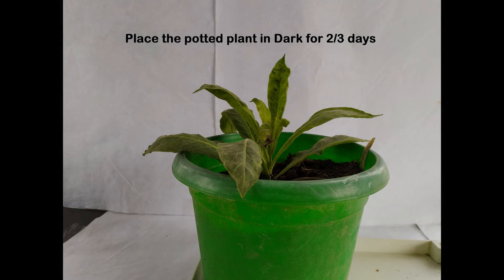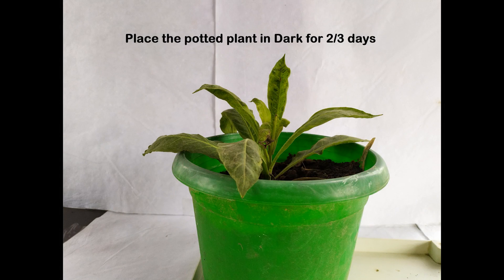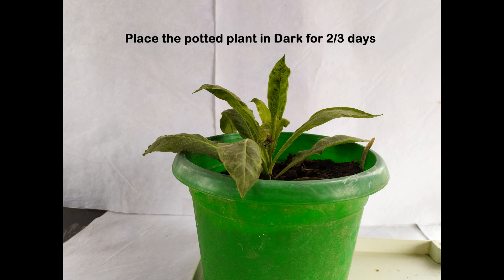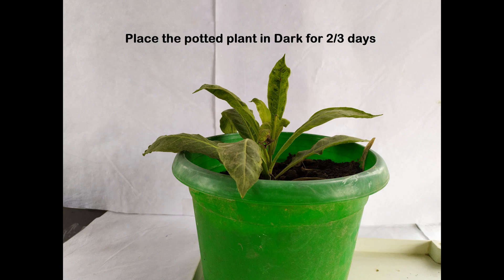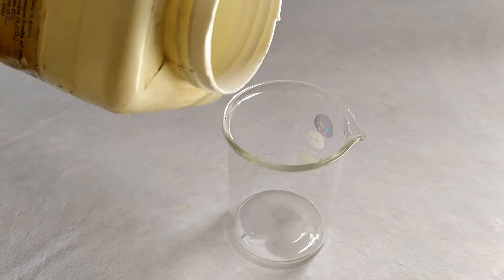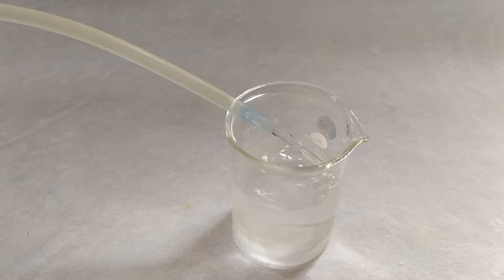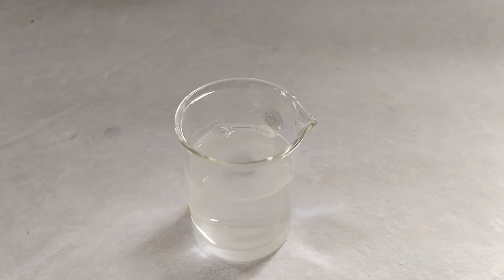Begin the experiment by placing the potted plant in the dark for about two to three days. This step is essential in order to rid the plant of any starch that was formed in the leaves prior to the start of the experiment. At the end of this time period, remove the potted plant from the dark.